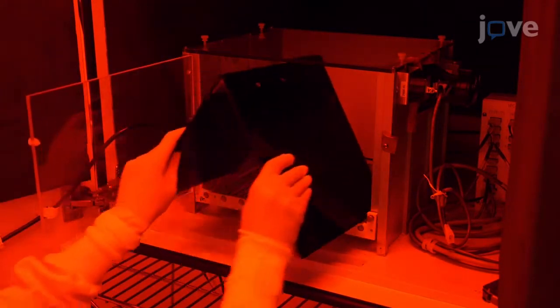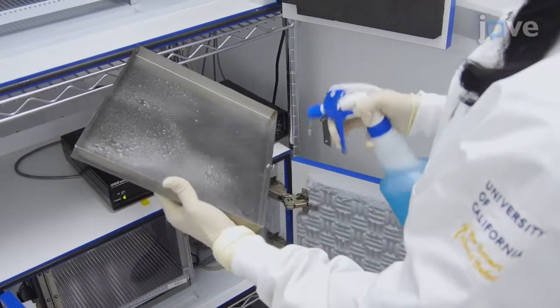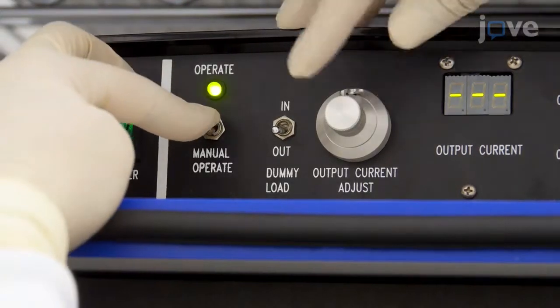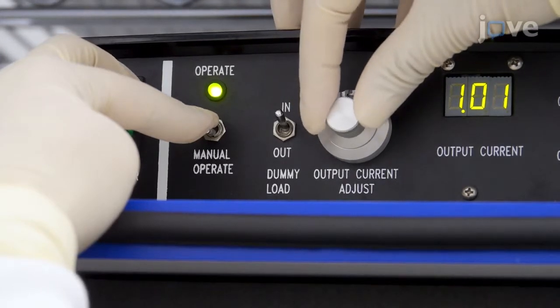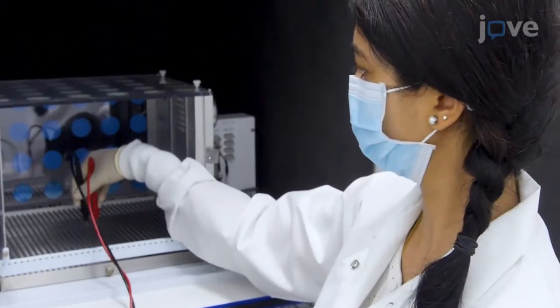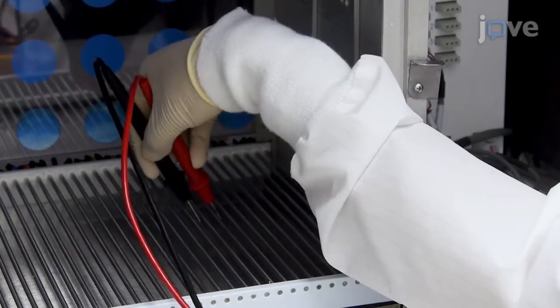Next, place black plexiglass triangular inserts in context B to differentiate the internal layout of the two contexts. Wipe down the chamber walls and doors and spray the pans beneath the grid floors with a diluted cleaning solution. After the grid floor is cleaned, connect a shock generator and scrambler capable of delivering a 1 mA or lower amplitude shock to each grid floor for foot shock delivery. Finally, use a multimeter to test the current being delivered by the shock generator by placing each probe on a different bar of the grid floor, and confirming that the desired shock amplitude is produced.